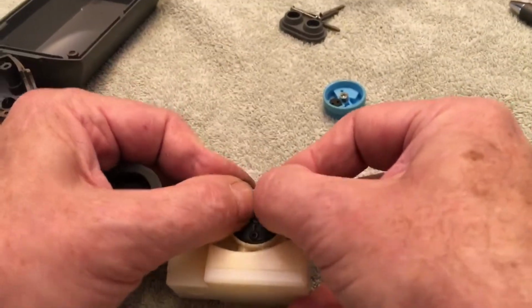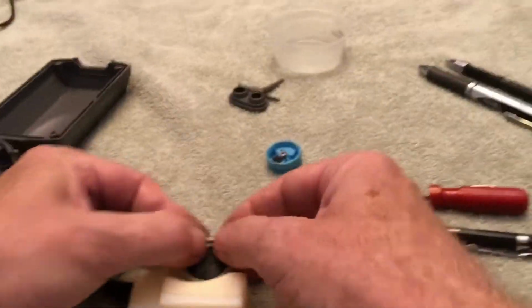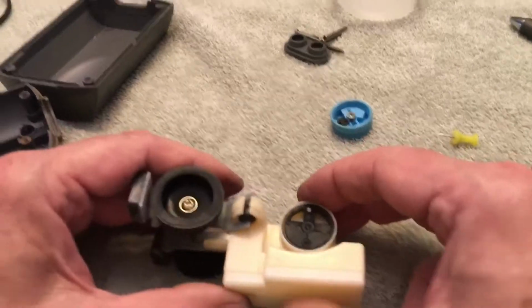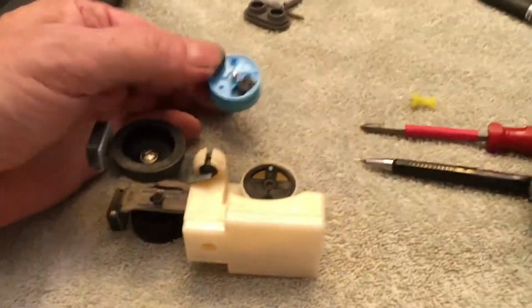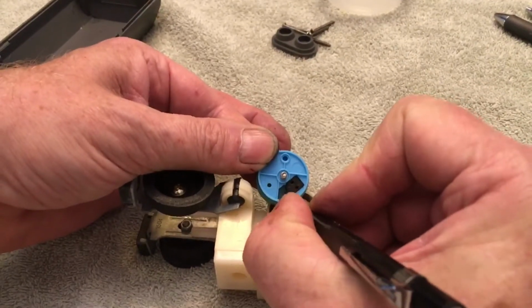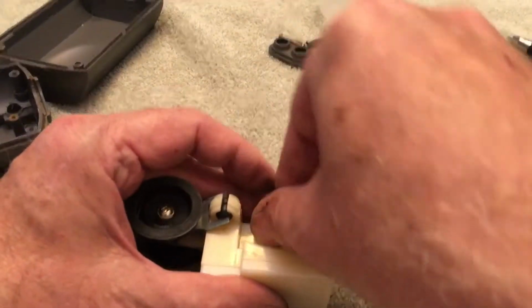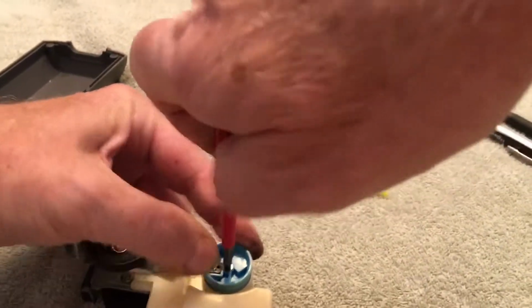Now, we're going to force it on the hole. And there you see, this is where it used to be set, and we forced a new hole. Now luckily, since we want to rotate this 180 degrees, here was the pin registration hole. Well, we just got lucky because there's nothing here, so we don't have to do any drilling or anything. We just put it back together and screw it down tight.